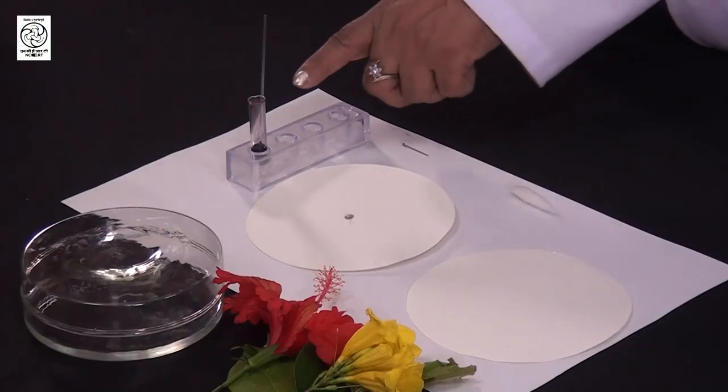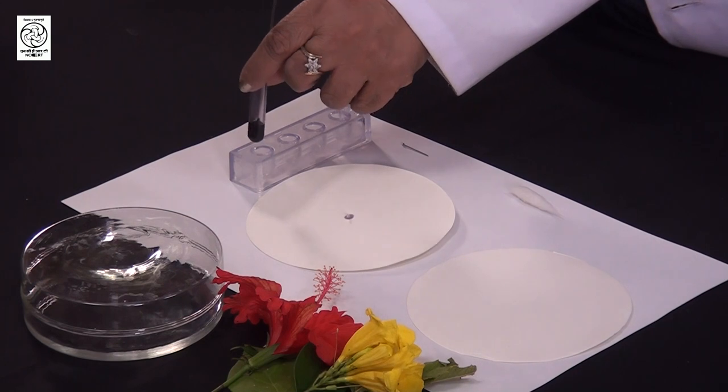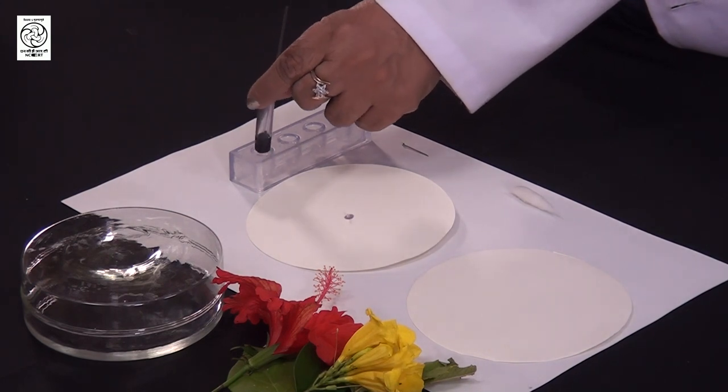Is it the paper? See, you have made a mistake. Though it is paper, it seems to most people that paper is the stationary phase. No — it is actually the water which has already been absorbed in the pores of this paper that acts as the stationary phase. Stationary phase is water here, not the paper. That should be very clear to you. And this is the mixture of compounds which is to be separated.